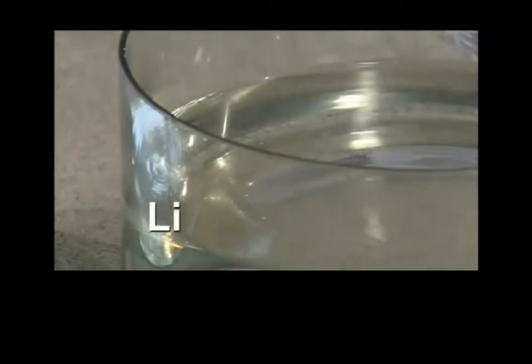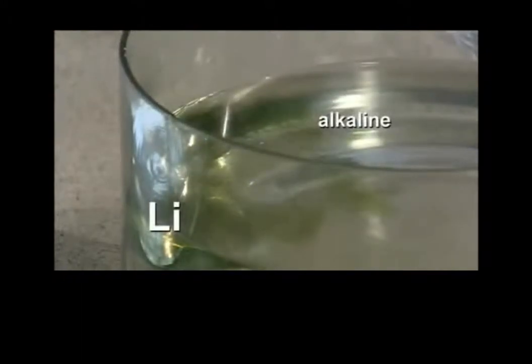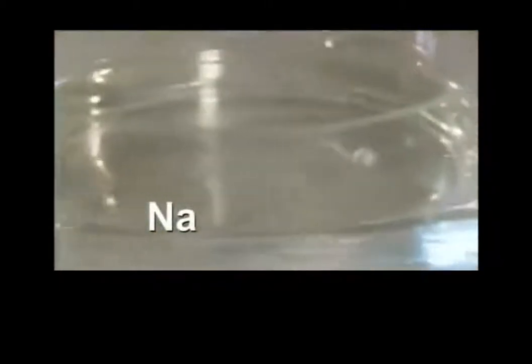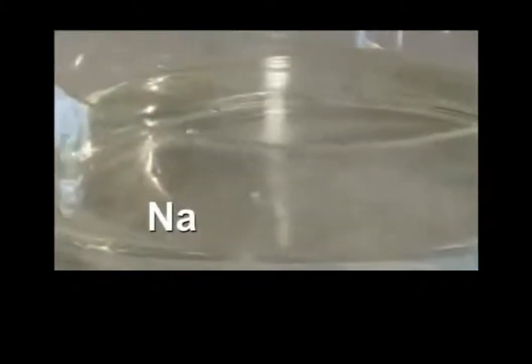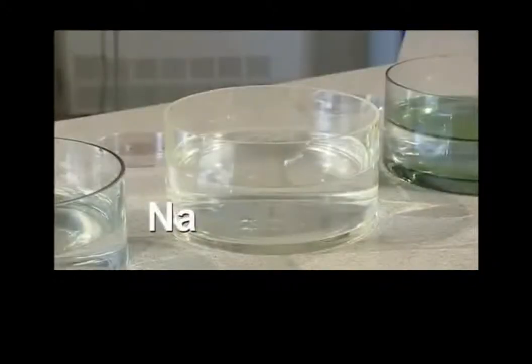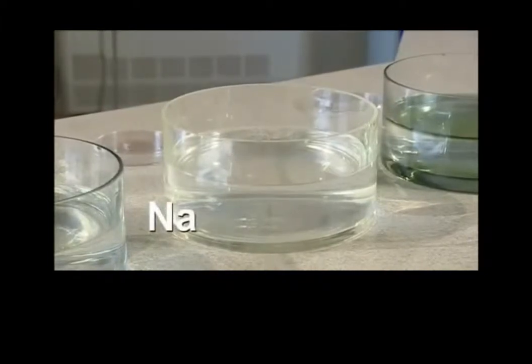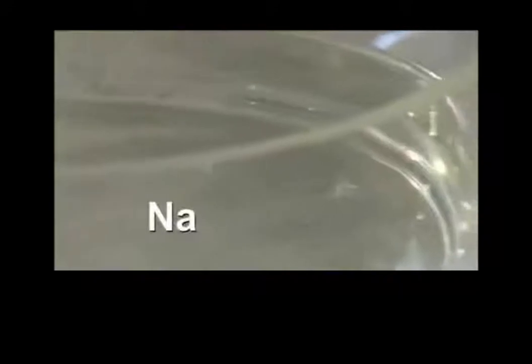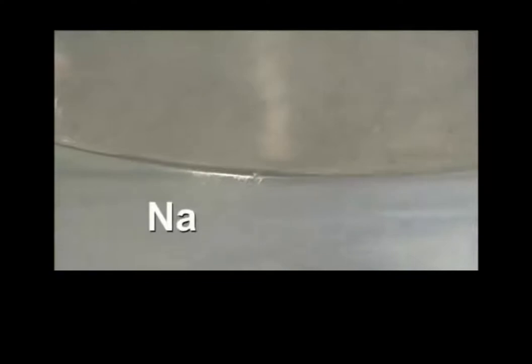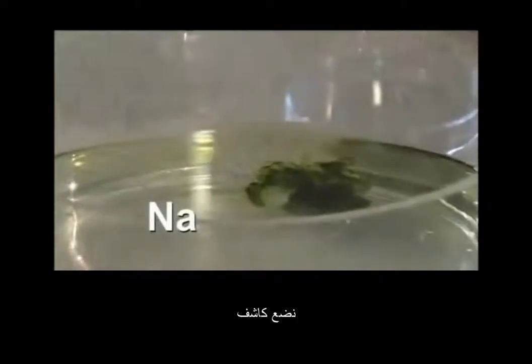When the reaction's finished, you can add some indicator.